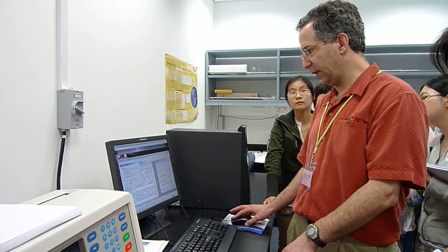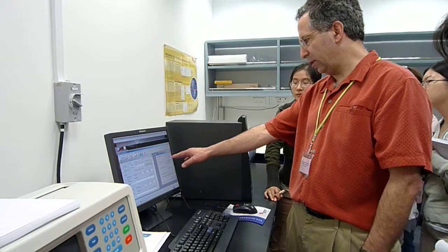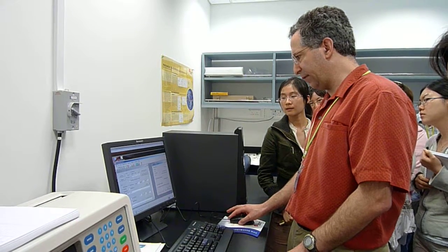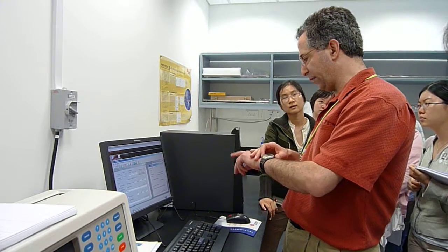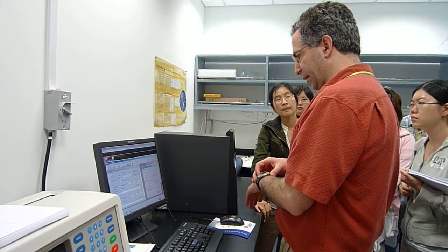I don't need to do another radial calibration because we just did one. It will now tell you that we're doing a total of 240 scans. That makes sense because we're doing 80 scans times 3 cells. It should basically start scanning every cell and never stop. It's just going to continuously go. When it shifts, it's going to go through cells 1, 4, and 5. When it shifts over to the next cell, I'm going to start my clock and see how long it actually takes. It should probably be about a minute and a half.